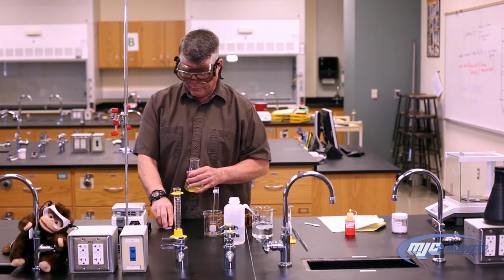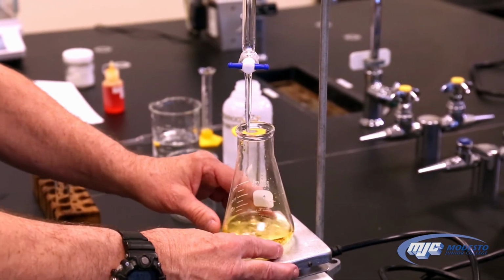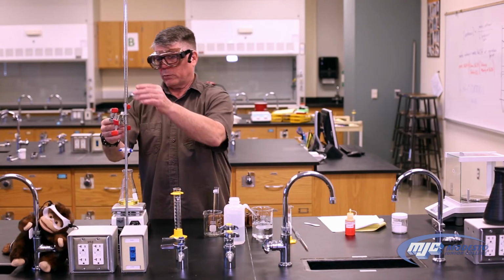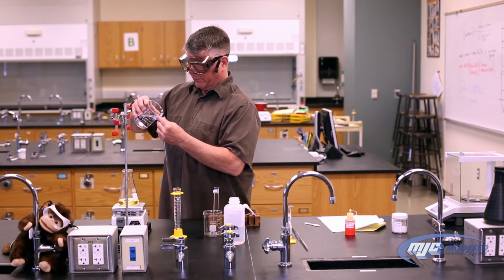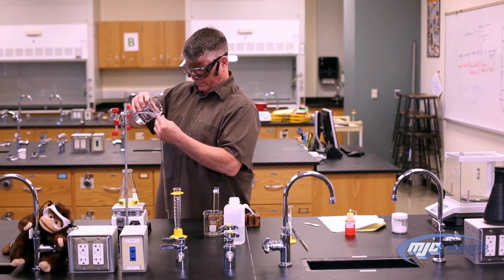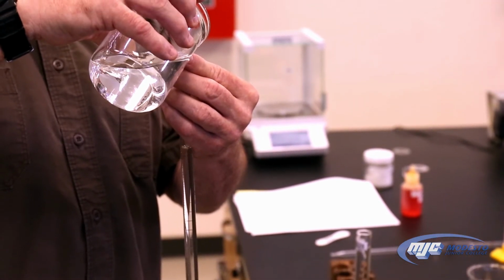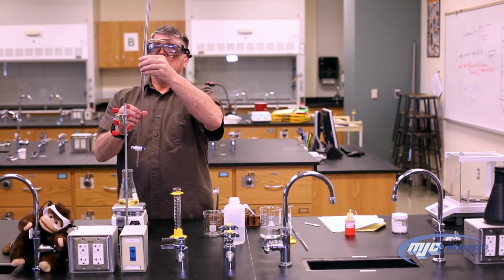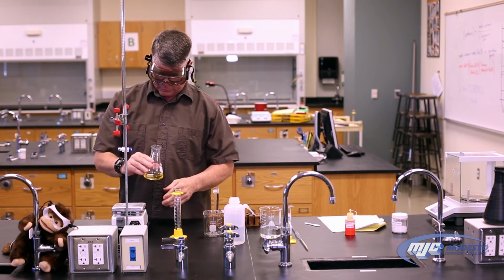While I'm filling up my buret, I'm going to put my magnetic stir bar into here, put this on the magnetic stir, turn it on, and let the stir bar start to dissolve the KHP. So now I'm going to add my stock solution to my buret. I've already rinsed this with DI water and with some of the stock solution. And when I fill this up, I want to fill it up above the top mark, which remember is a 0. There you go. So now I have the buret full, but at this point there's going to be some air bubbles in the tip, which we have to get out. So this looks like it's pretty much not quite dissolved.